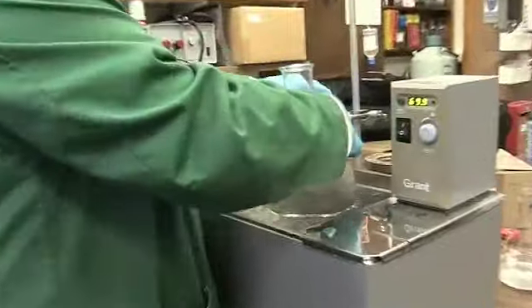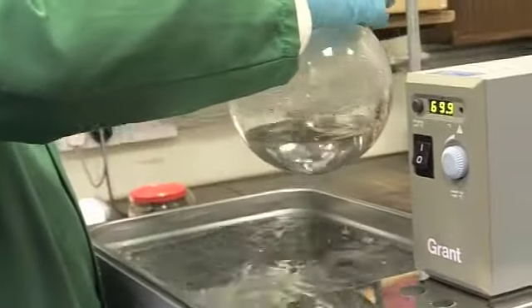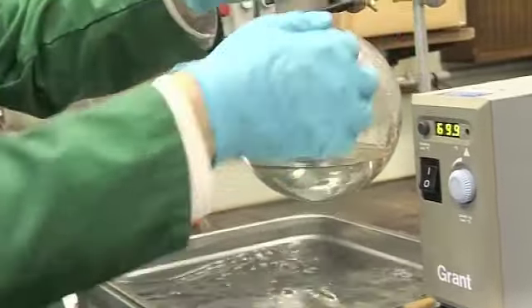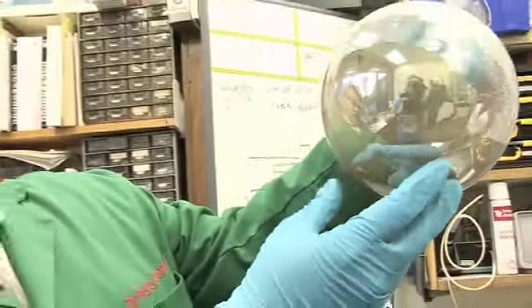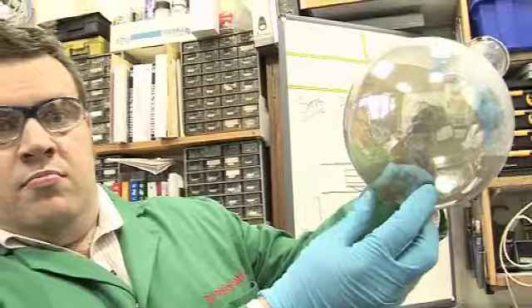And we're just going to lift it up now out of the bath. We can see almost instantaneously that the solution itself has gone all gray, which tells me that something's happened to the silver. Now I'm going to rotate the flask. And I think you can see there's a really nice mirror which has been formed on the bottom of that flask.